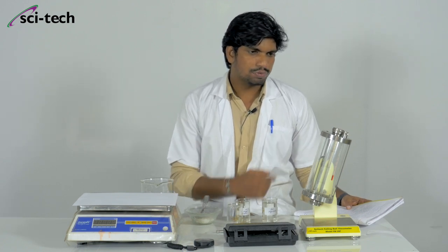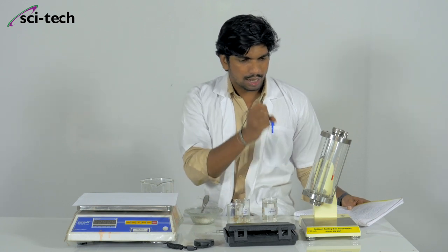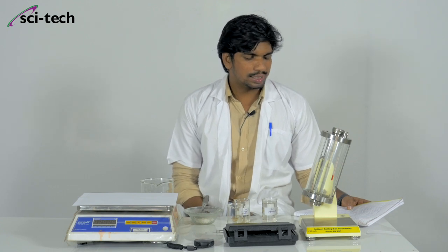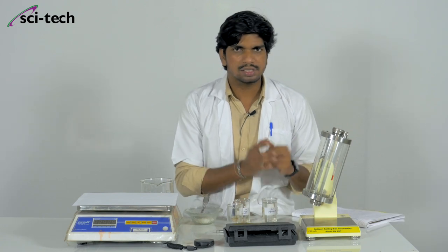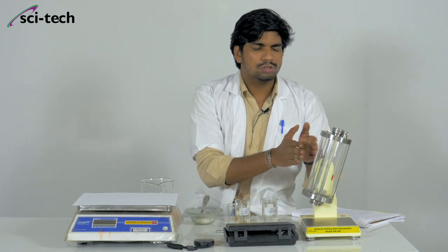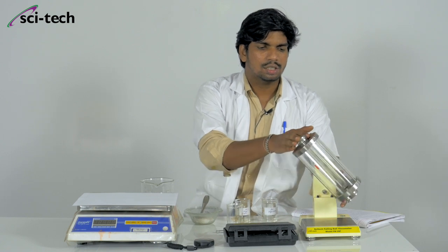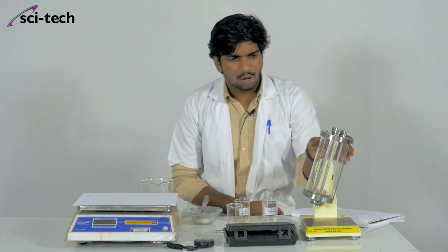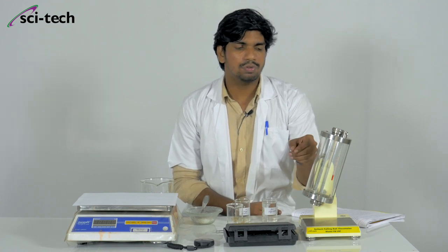Newtonian fluids — what are they? A Newtonian fluid is a fluid in which viscous stresses arising from its flow at every point are linearly proportional to the local strain rate, that is, the rate of change of its deformation over time. In simple terms, in this instrument, as you can see, there is one glass container. This glass container can be rotated 180 degrees from top to bottom around this bevel screw. We have one outer glass and one inner glass, and the inner glass contains your Newtonian fluid.